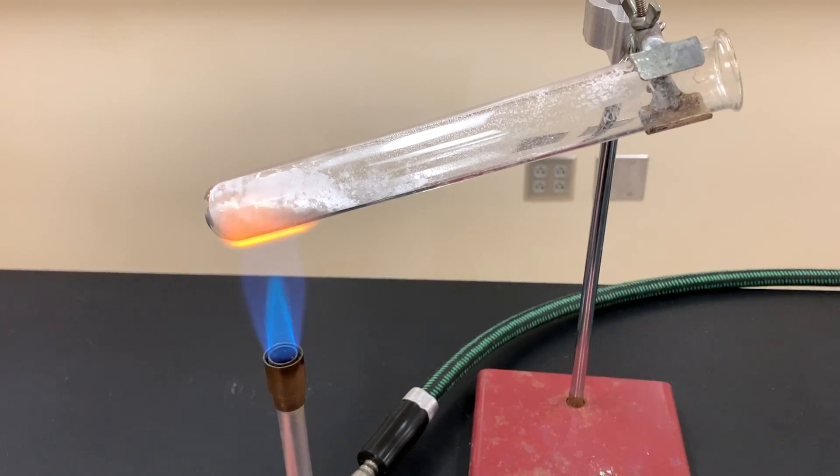I'm gonna do just one heating and so I've heated it for about 10 minutes so I'm going to turn off the Bunsen burner.